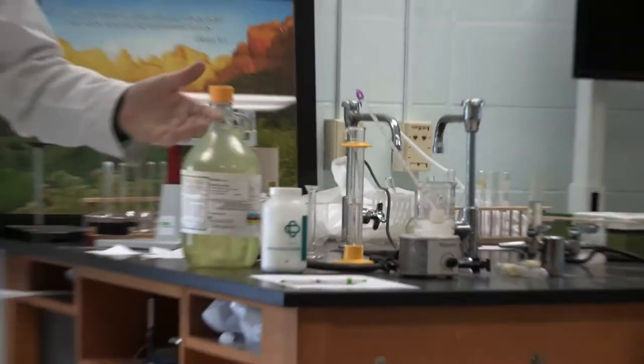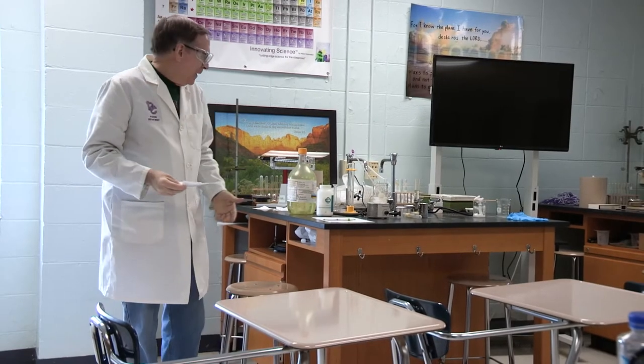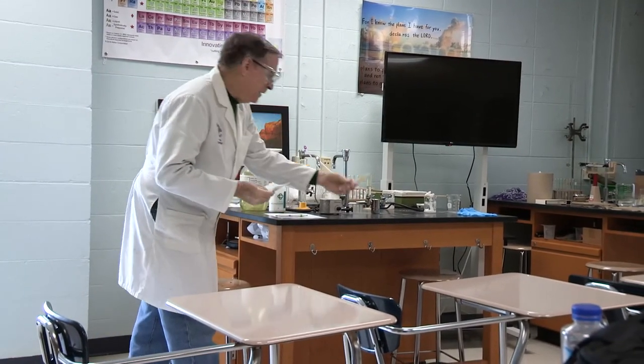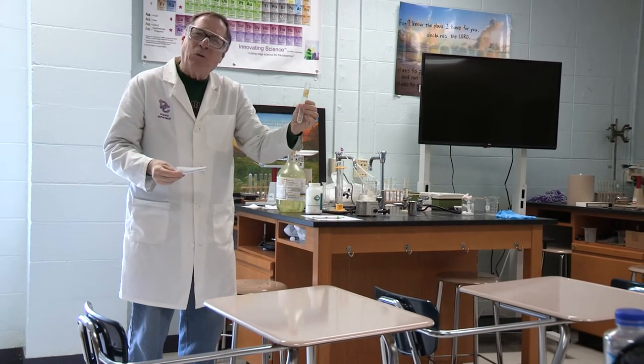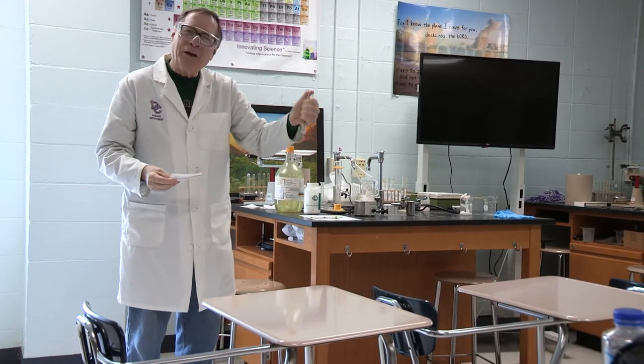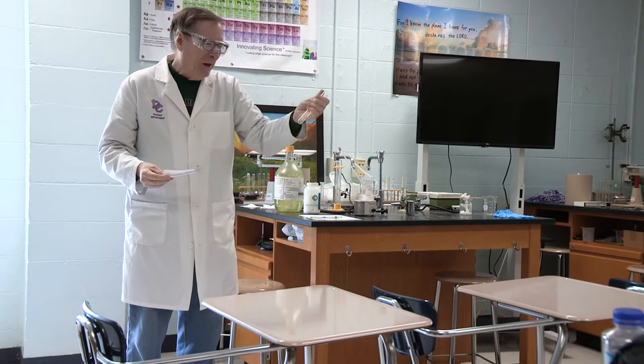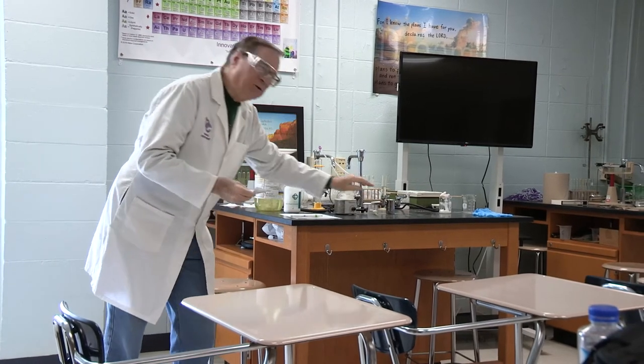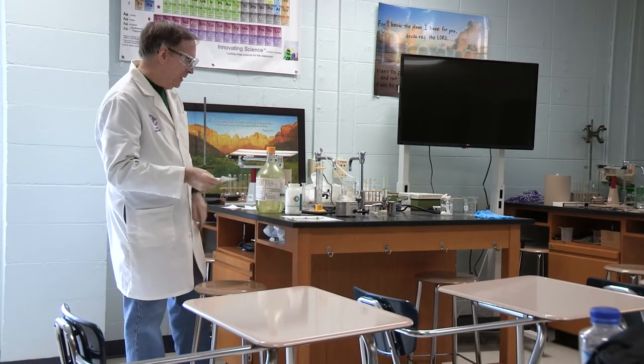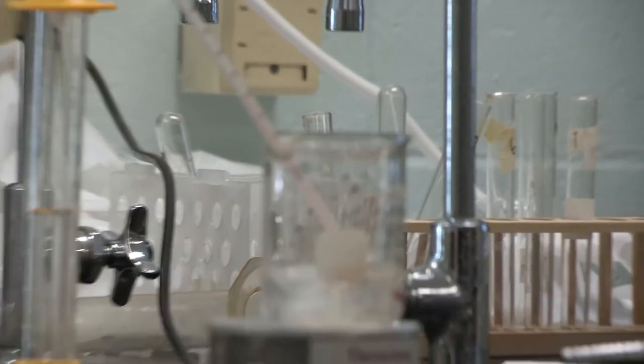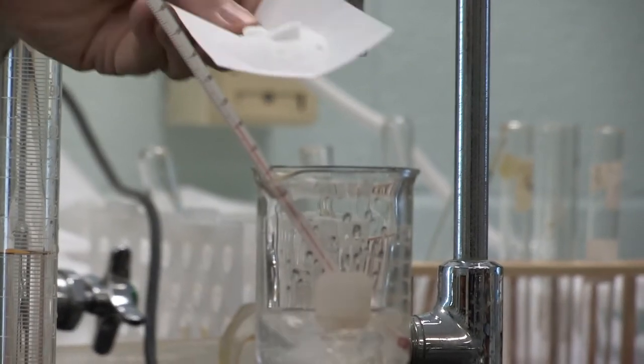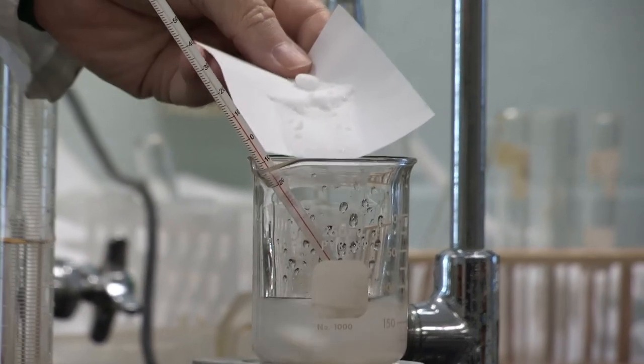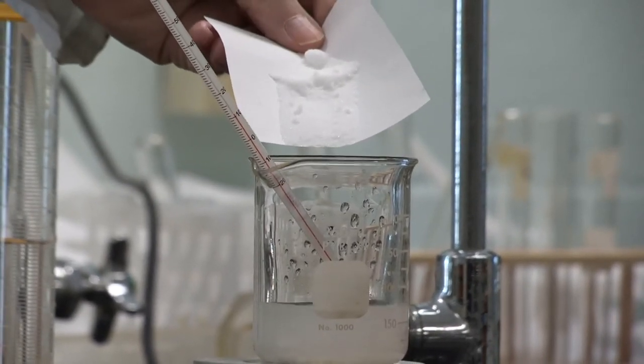Let's see what happens if we add another 10 grams. I'm experimenting. I haven't done this myself. What I've always done for my students in the classroom is I always had them take a test tube and fill it half full of water. I just put a scoop in and had them shake it. And they felt, oh, it got cold. Because you're not here for me to let you shake it, we're doing it this way. I'm going to add another 10 grams.